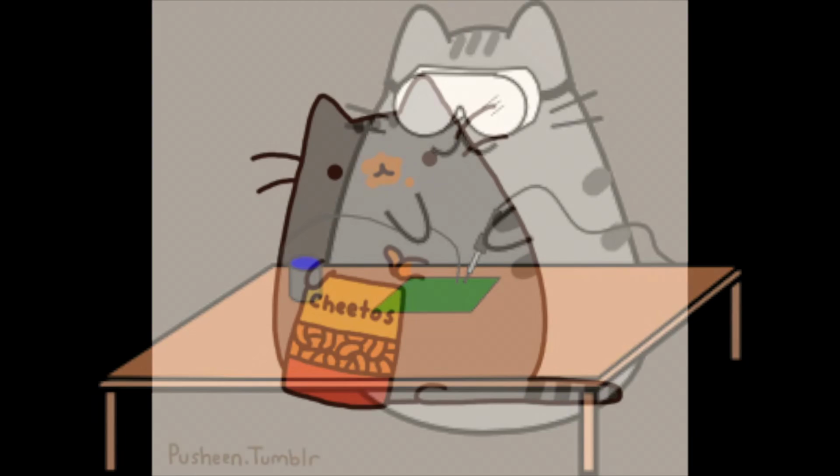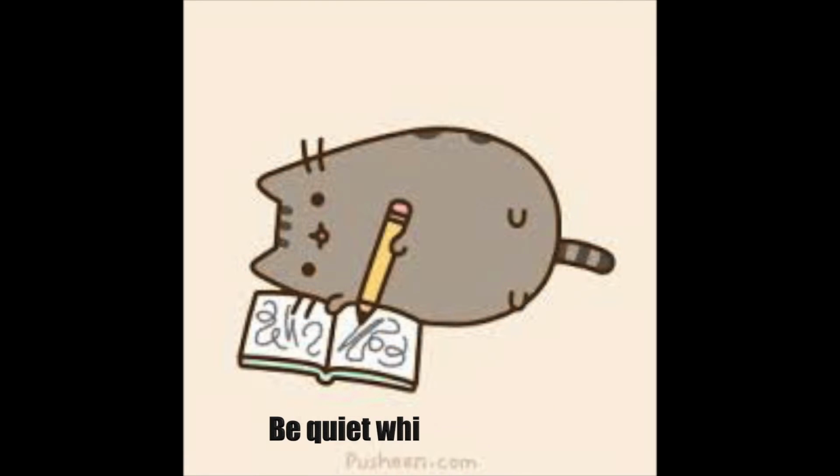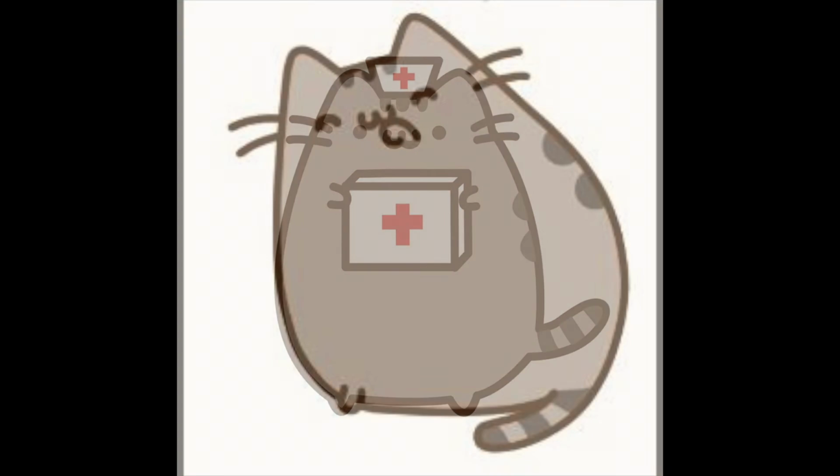Wear goggles on your eyes and don't eat or drink. Be careful with the chemicals, don't put them down the sink. Be quiet while you work and read the directions. Wear gloves on your hands, it's for your protection.